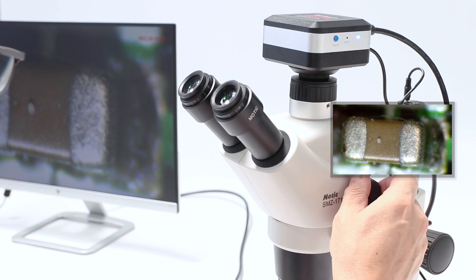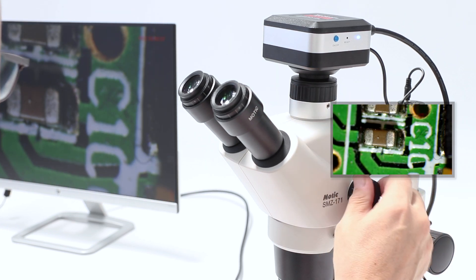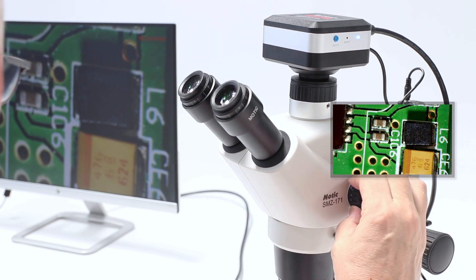Once the image is clearly focused, switch to a different magnification. As before, the sample stays in focus.